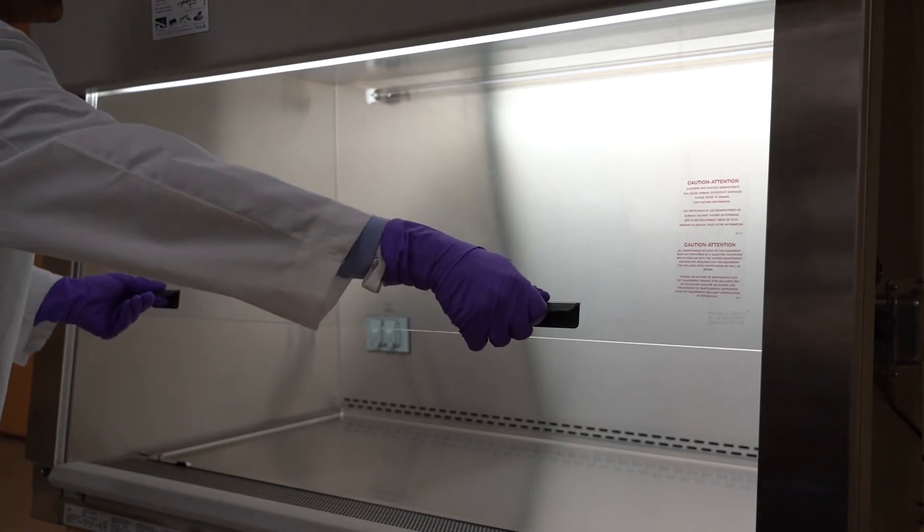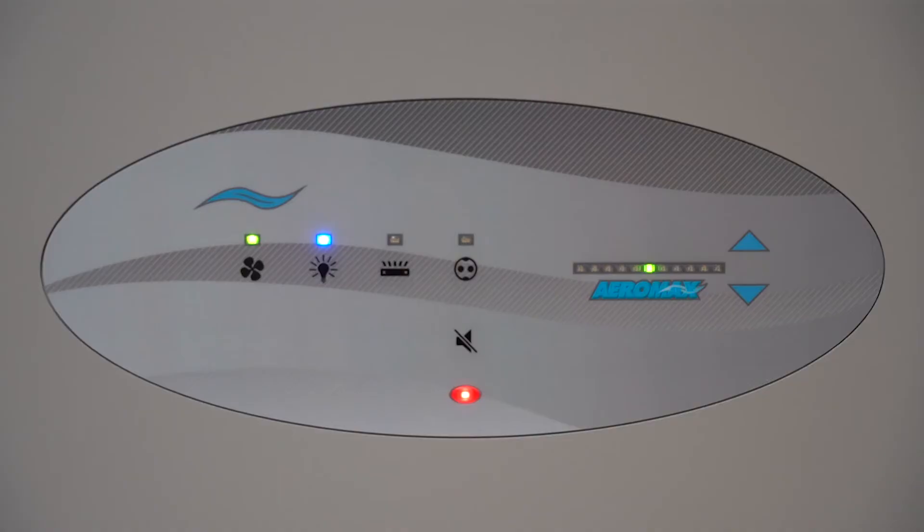Your certifier or technician may program the cabinet to work in nightcare mode when not in use. If programmed, simply lower the sash to enter this nightcare mode.